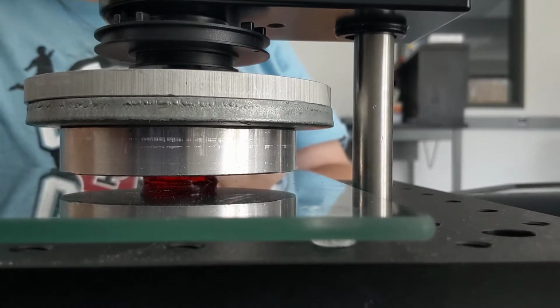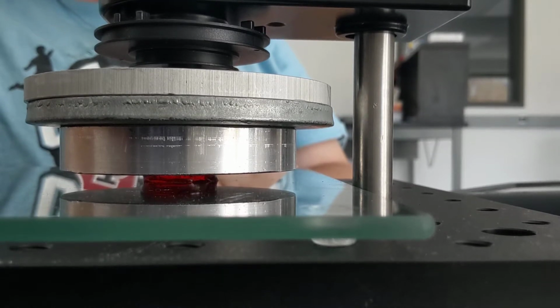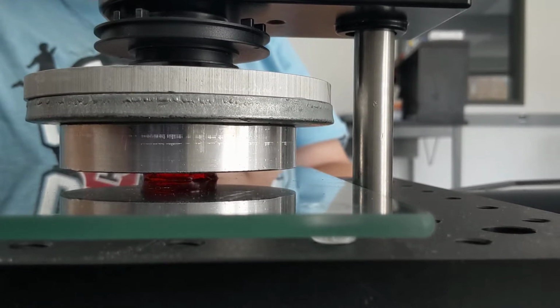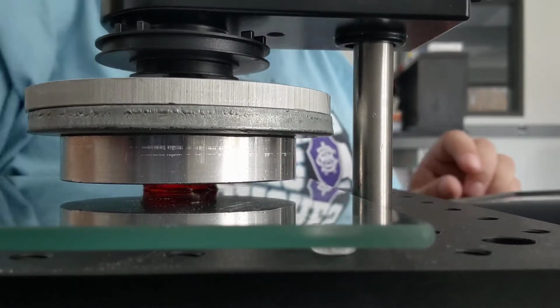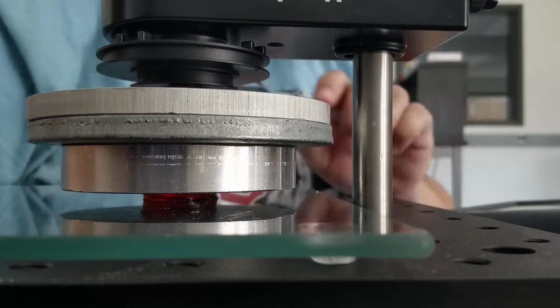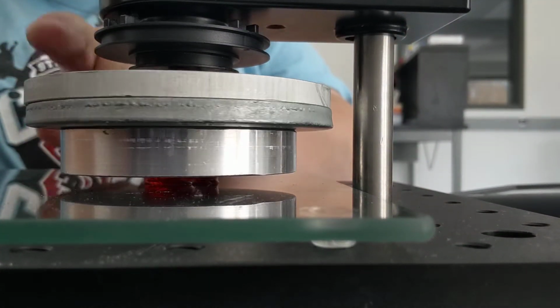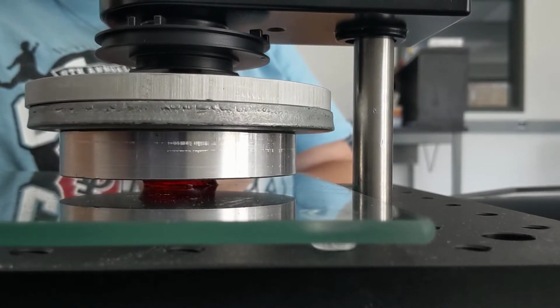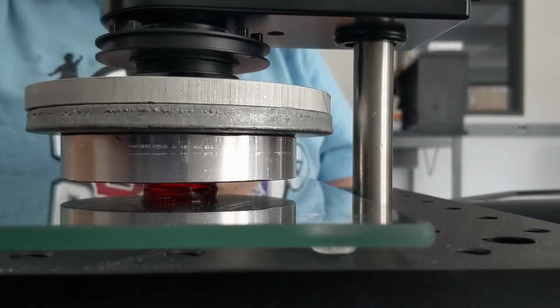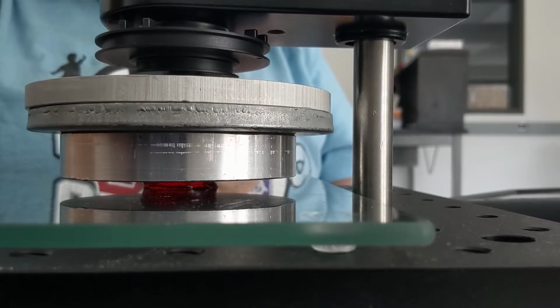Because of the presence of the sample underneath the disc, we're going to get a damped oscillation, which is going to look like a sine curve, where the amplitude of the curve gets smaller every time. So I'm going to go ahead and press record on my sensor, and I'm going to give my disc a nudge. And you can see those oscillations back and forth being caused by the presence of that Jell-O.